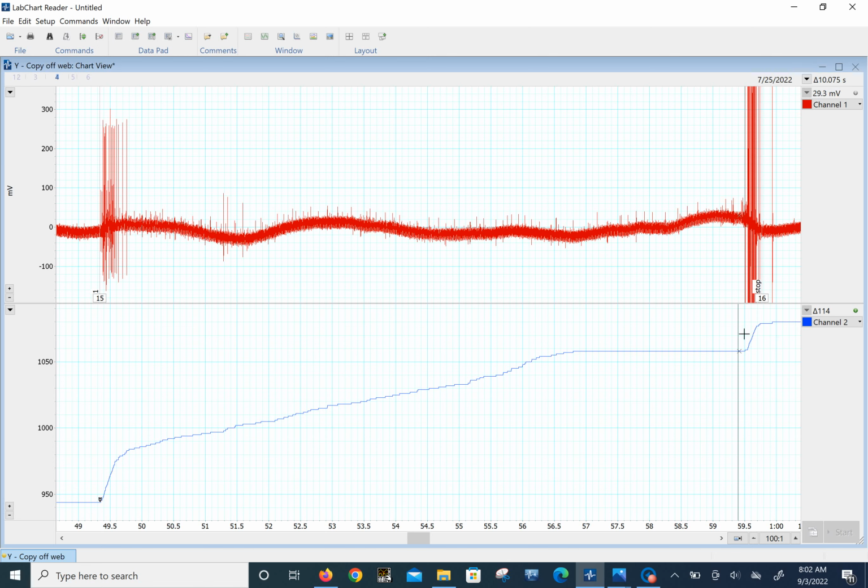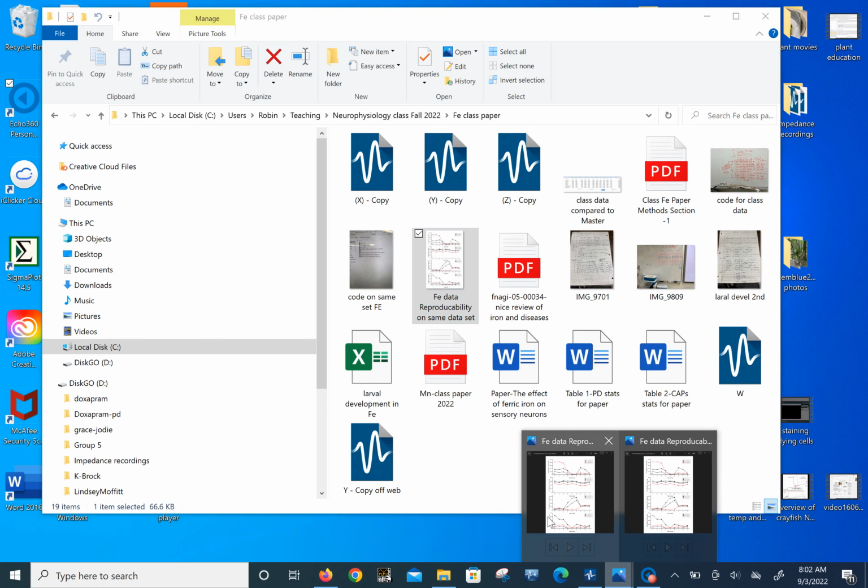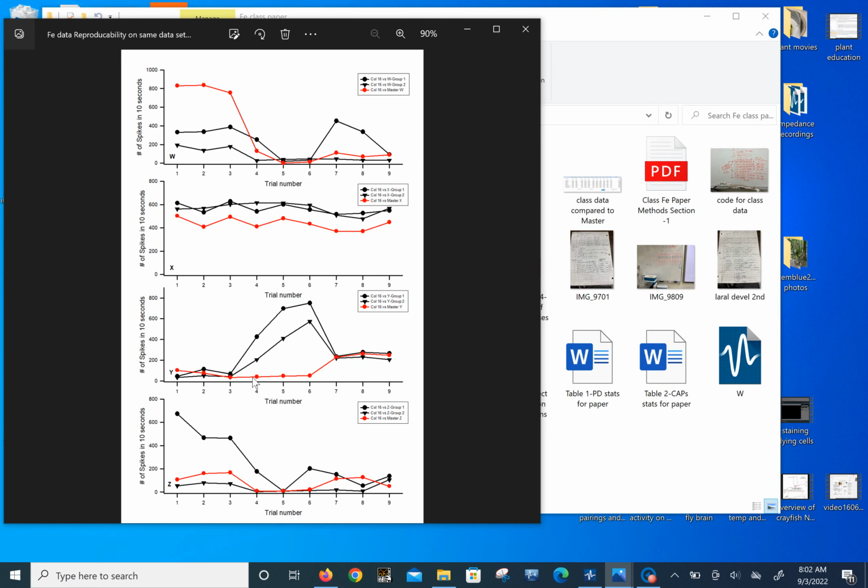And, you know, that 114 fits pretty well if we go back to one of these. Here's 100 in there. So we're back into this level. If we only wanted to count the large spikes, we would be down at 27, which would be down here. So we must be counting those spikes just above the noise in this data set. But in these two data sets, we're getting the 60 cycle noise that's inside of those traces. It's because the baseline wiggles up and down so much compared to the baseline didn't wiggle as much in here.